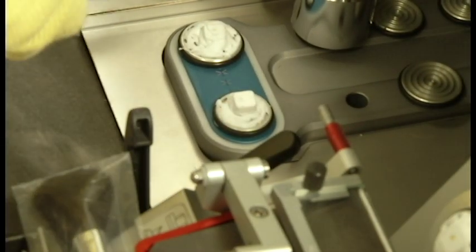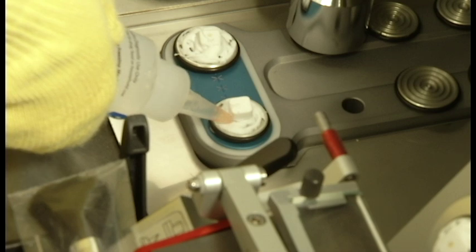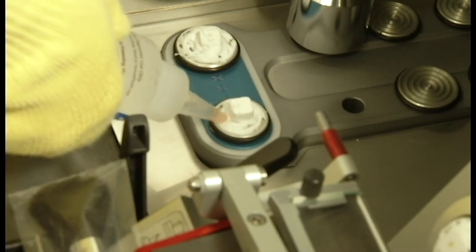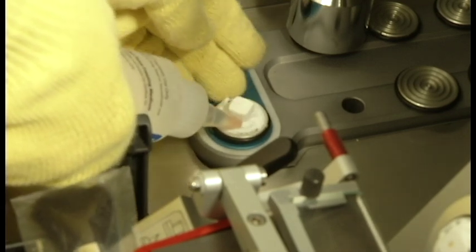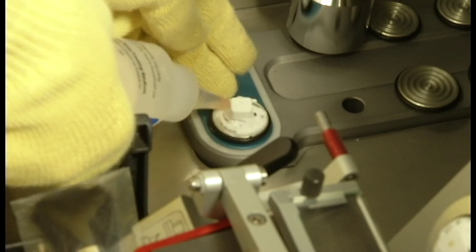If it does happen to come off, or if the entire structure comes off of the specimen disc while you are cutting, simply create a new base and re-freeze the sample onto the specimen disc.